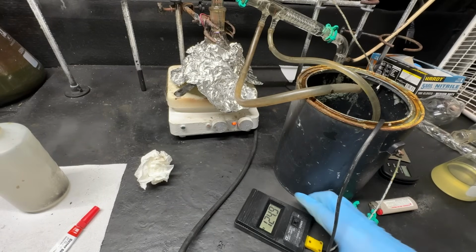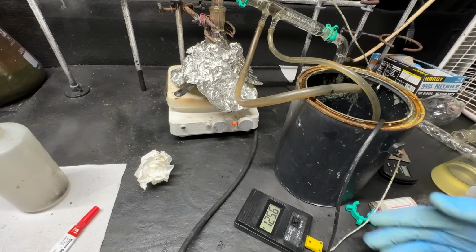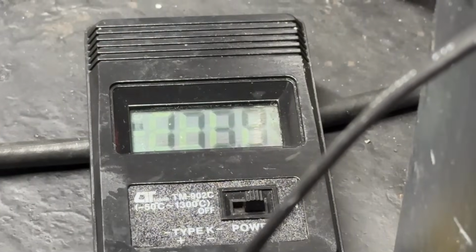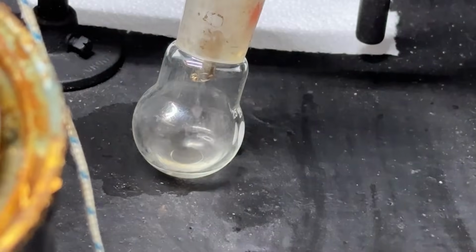Okay, our temperature is climbing fast. We're at 124 C when you get to around 176. So we got a bit more to go, but it's over the boiling point of toluene and it's over the boiling point of isoamyl alcohol. So should be good news that we're going to get our isovaleric acid soon. Yep, and we're stabilizing at around 174, so only 2 degrees off. So that is good news.